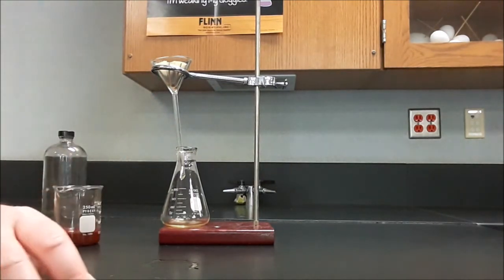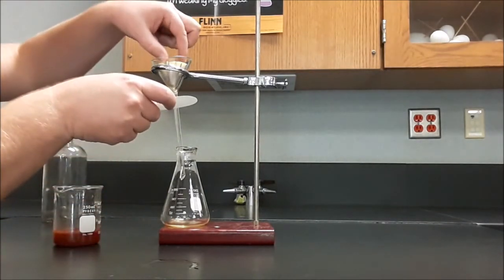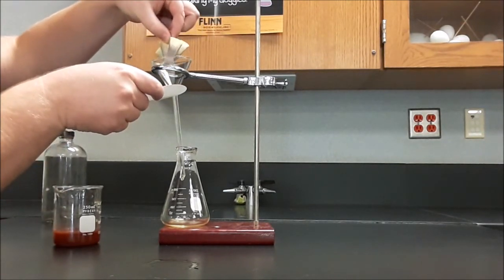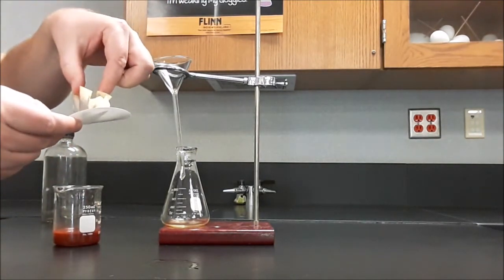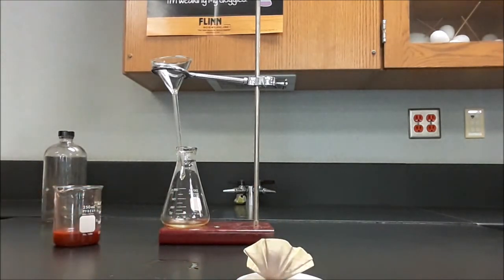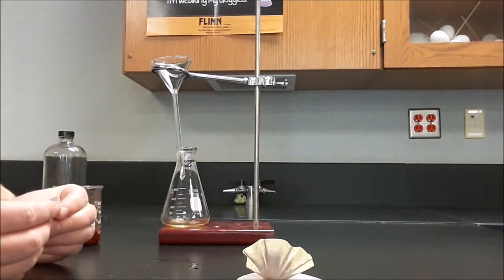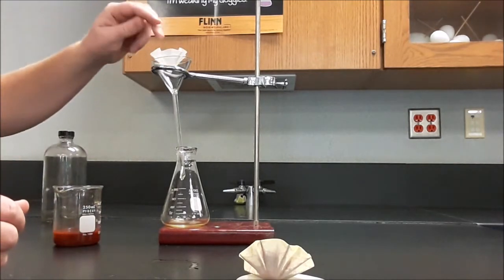So what I'm going to do is I'm going to call this one. I'm going to get my doily paper, and I'm going to pinch the filter paper closed and pull this out, and it's all drippy and wet, right? So I've got my doily underneath it. And then I can carry this to the drying oven. So I'm going to set this aside. I'm going to grab 2 more pieces of filter paper, fluted, ready to go. We put it in.